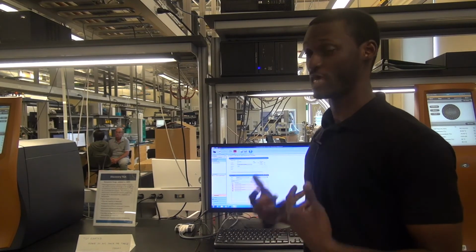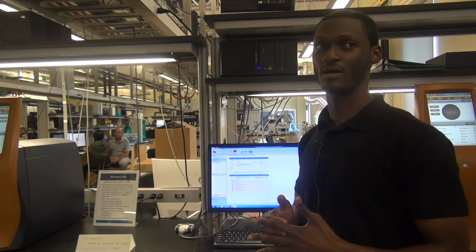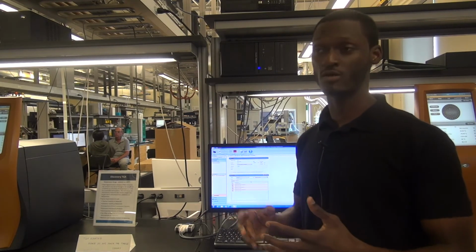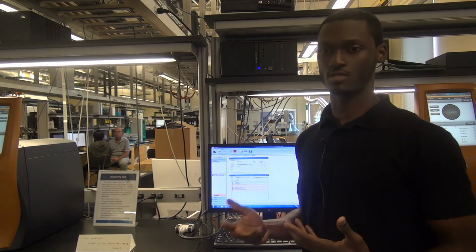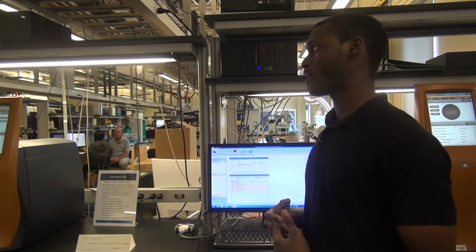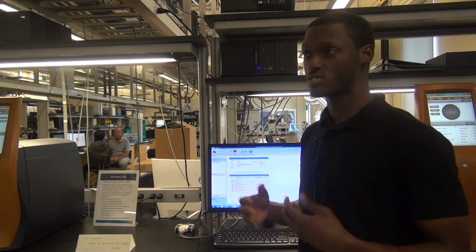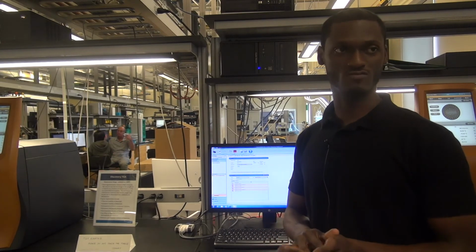Now, if you care about that, so if you're doing something like 3D printing, for example, and you care about looking at the configuration of the polymer as soon as you've physically made it, then your first heating scan is going to be very important to you, because that's where all of that information is going to be stored. Now, if you don't care about that and you just want the bulk properties of the material, the first heating scan may not be very useful to you.